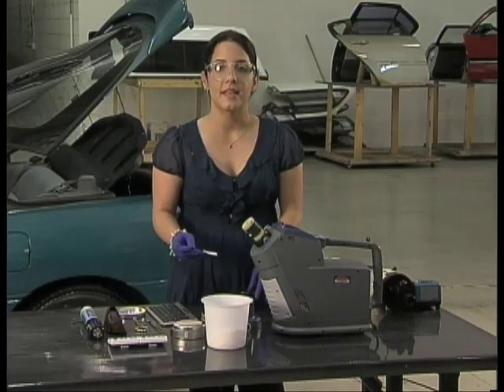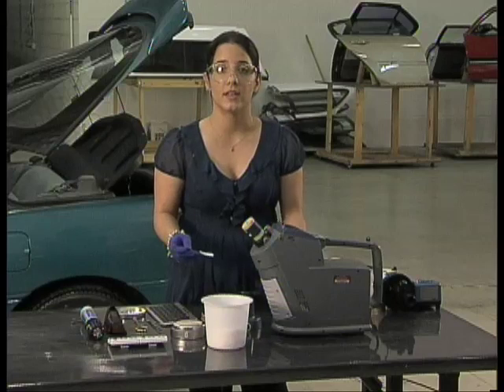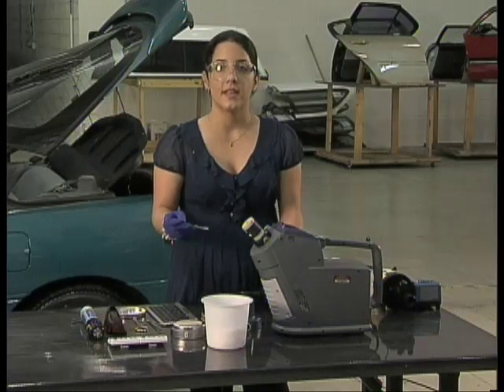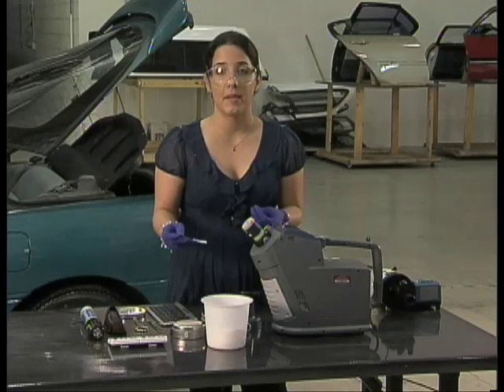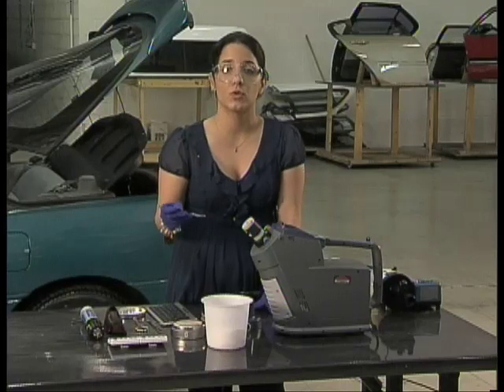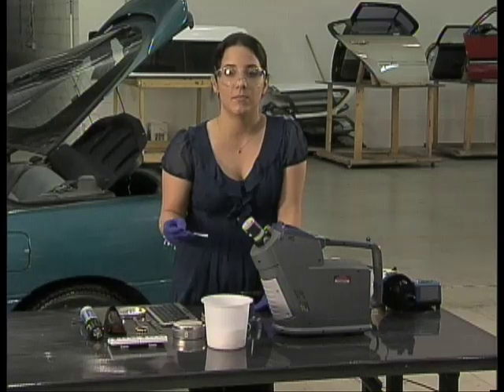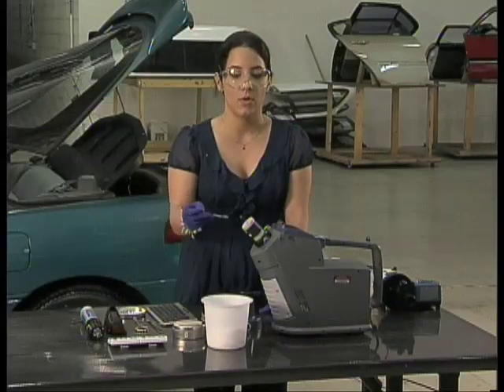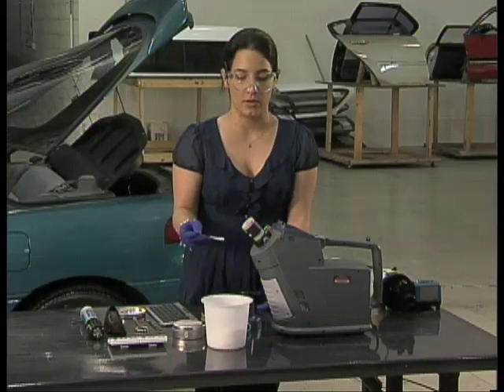We have to bear in mind that these explosives were contained within two containers. This shows that the odors permeated through the bag and outside of the electrical box. The PSPME device, suspended statically within the trunk, was able to absorb these vapors, and with the aid of the IMS detector we were able to see three distinct peaks indicative of smokeless powders.